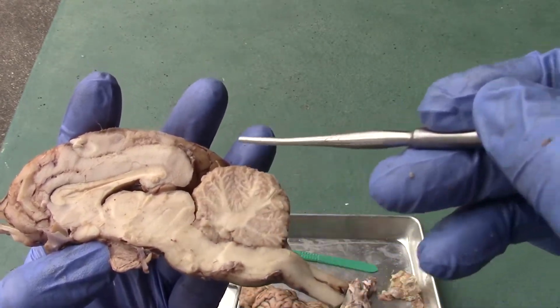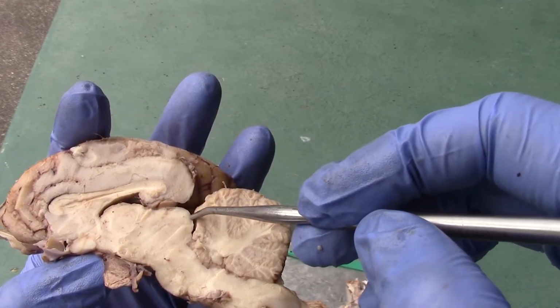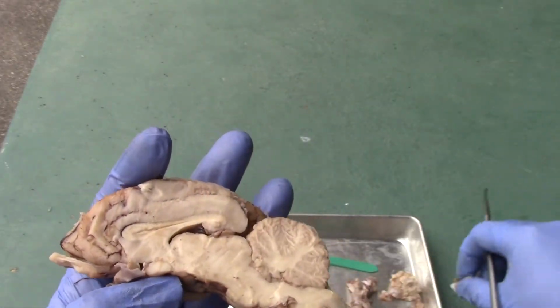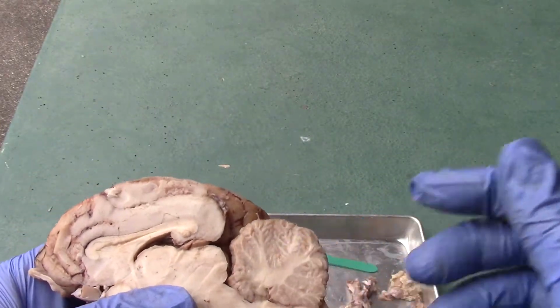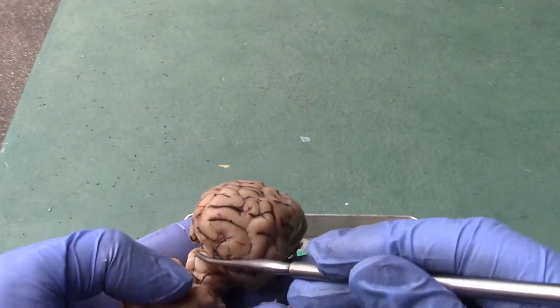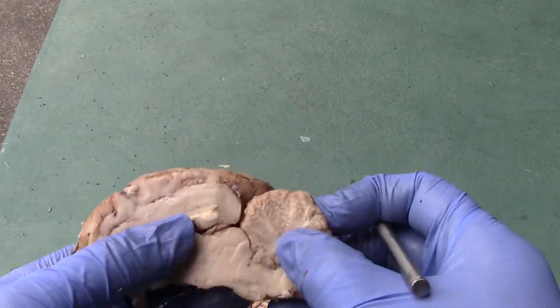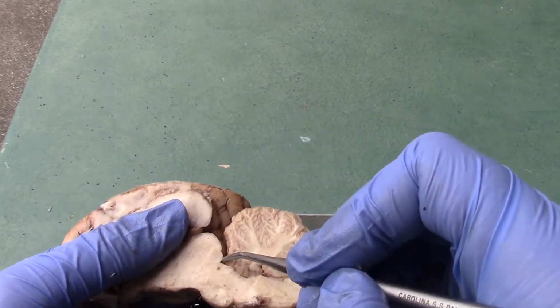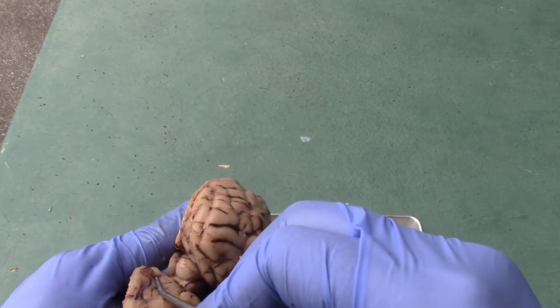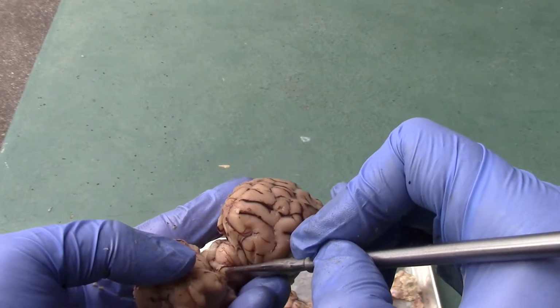We have the midbrain once again, and the superior structure here, this big bump, is the superior colliculus, and just a smaller bump right there is the inferior colliculus. I'll show it to you once again as I rotate it. Right, superior colliculus, rotate it right there, and then the smaller bump down here will be the inferior colliculus. If I rotate it, you could kind of see it from here. Inferior colliculus.